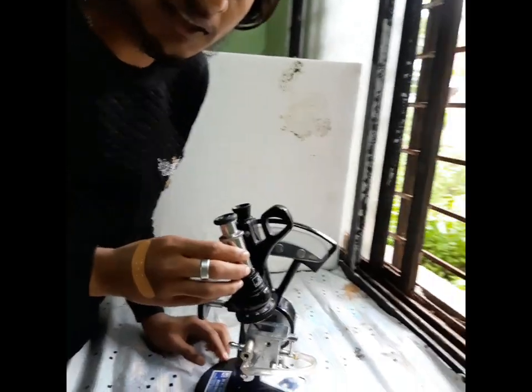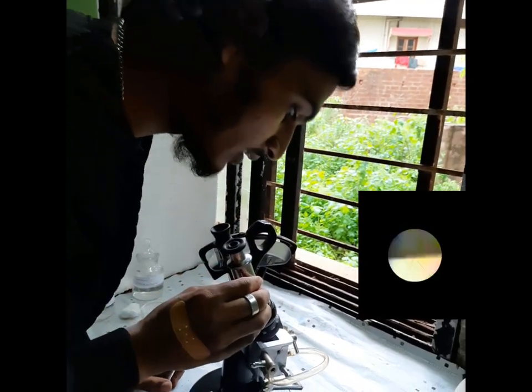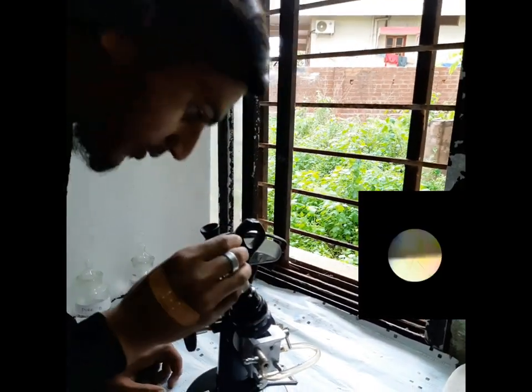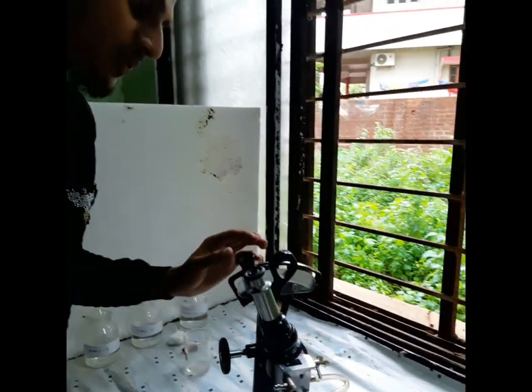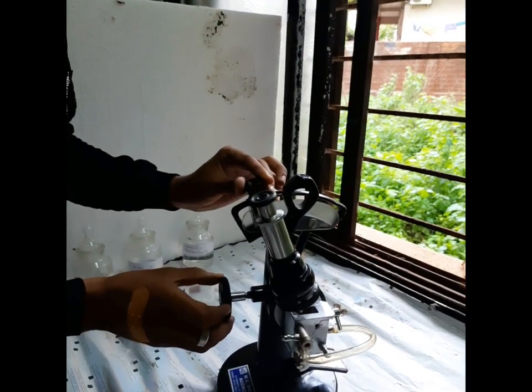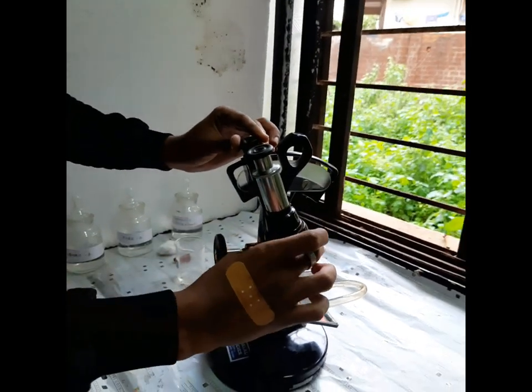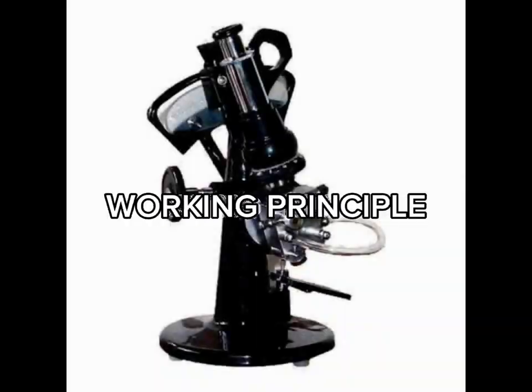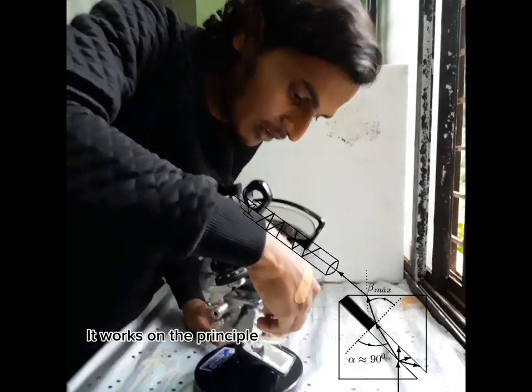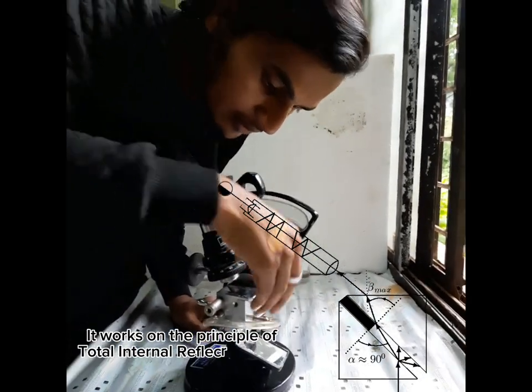Here these two eyepieces are there. This one is for observation and this one is for reading purpose. We can adjust this by this adjustment knob. This experiment works on the principle of total internal reflection.